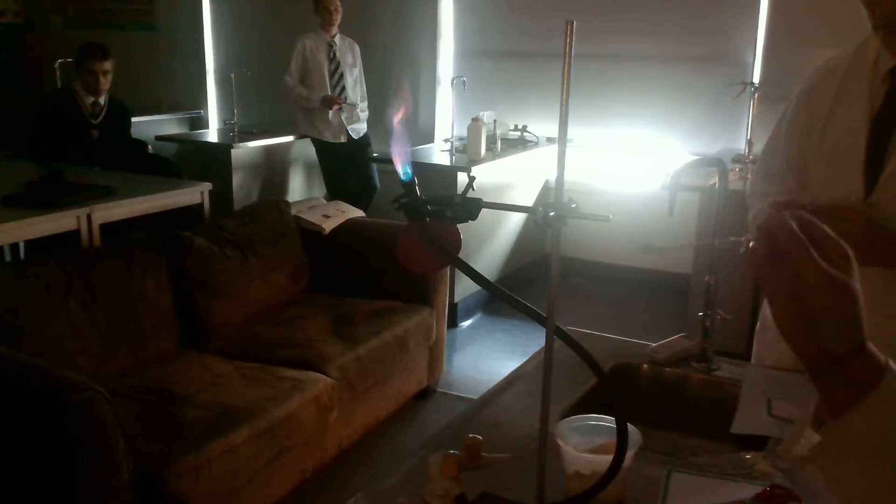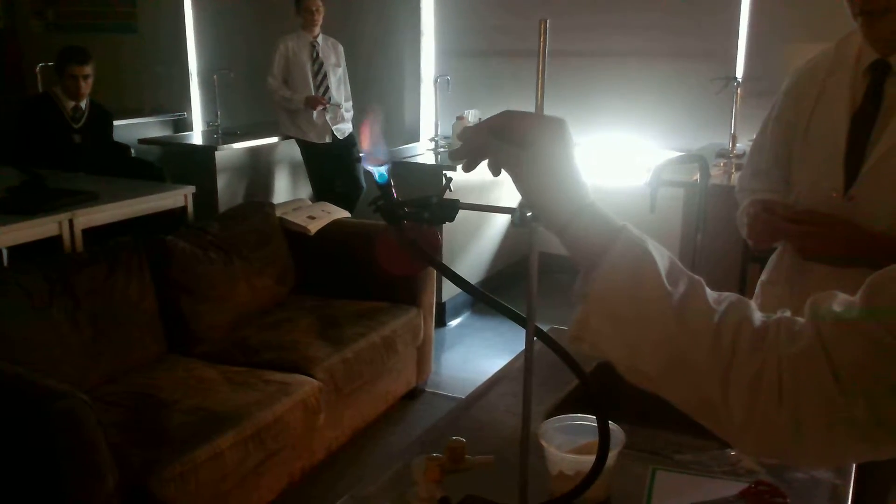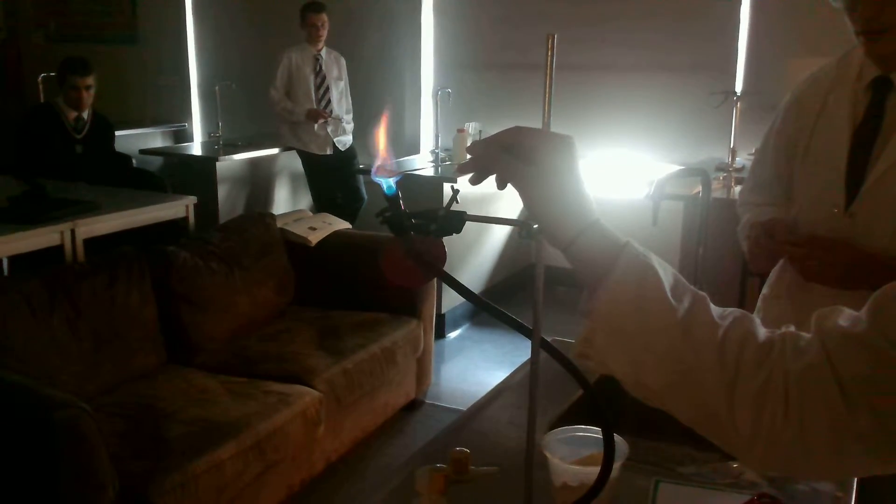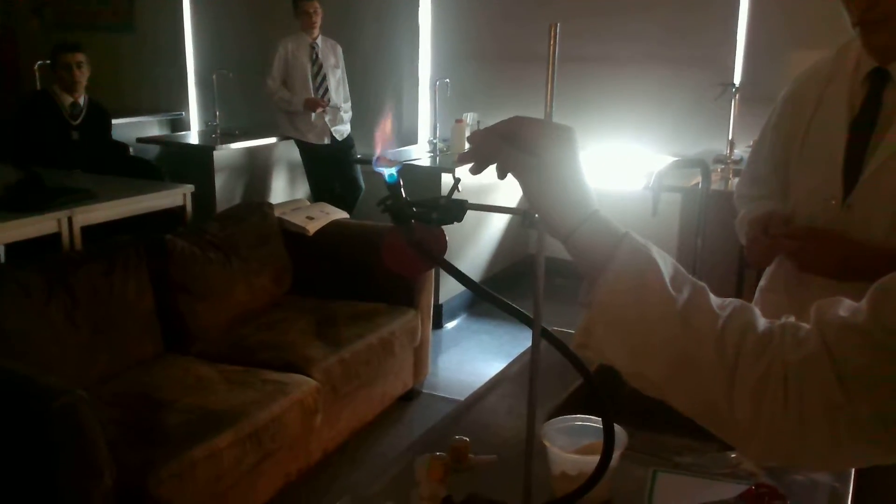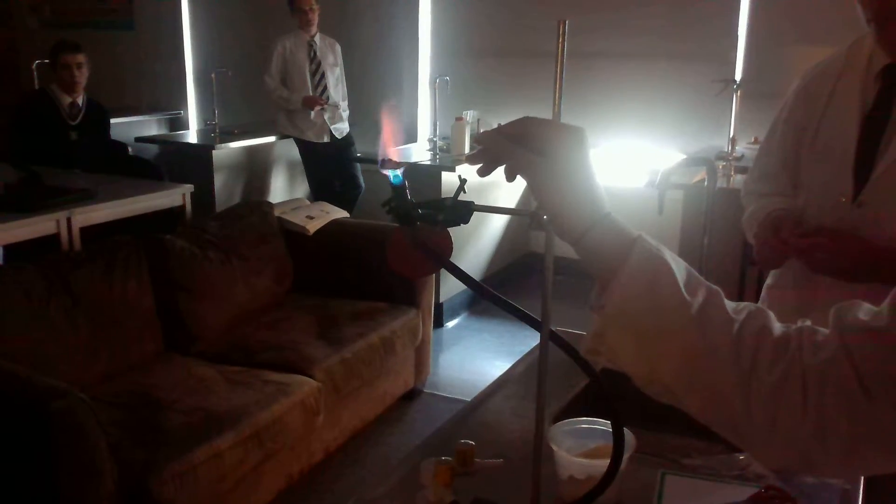First, we're going to have a clump of flour being placed in a Bunsen flame. We can see that it's starting to go black, so we know there's a reaction happening and there's a yellow flame coming off that. We know it's reacting but not particularly quickly.